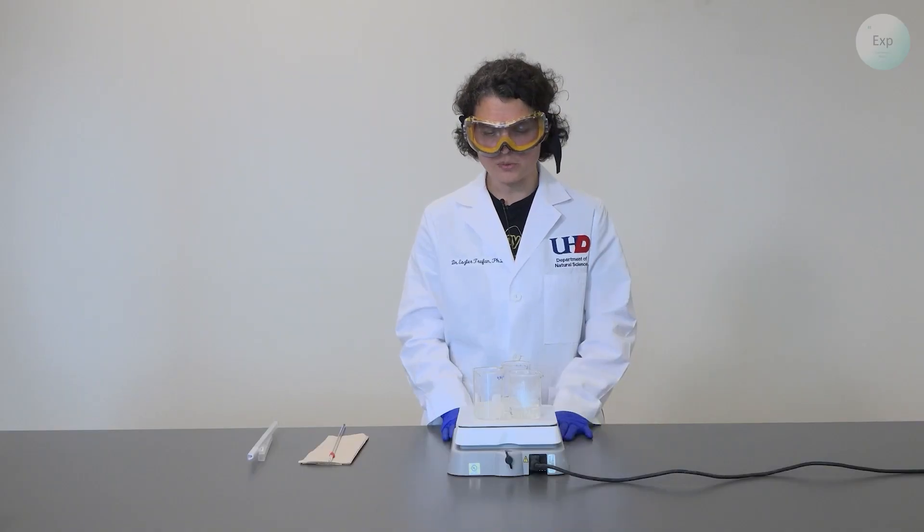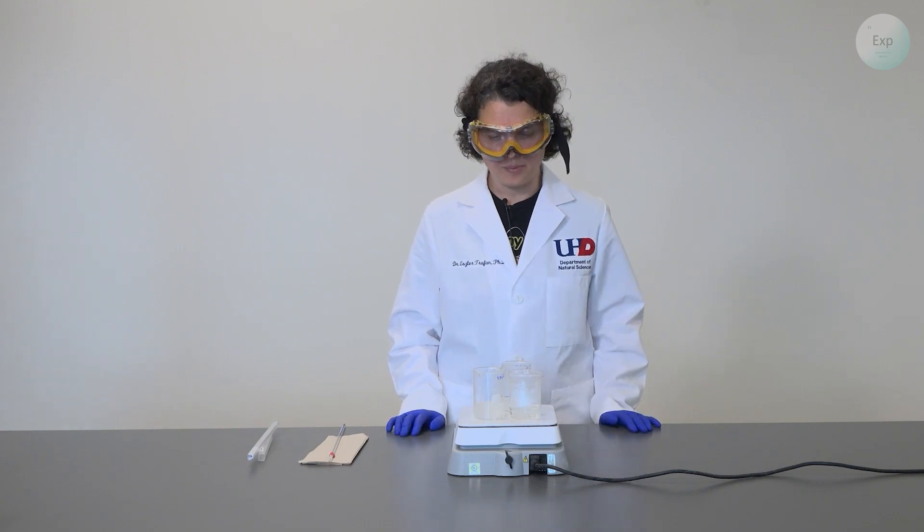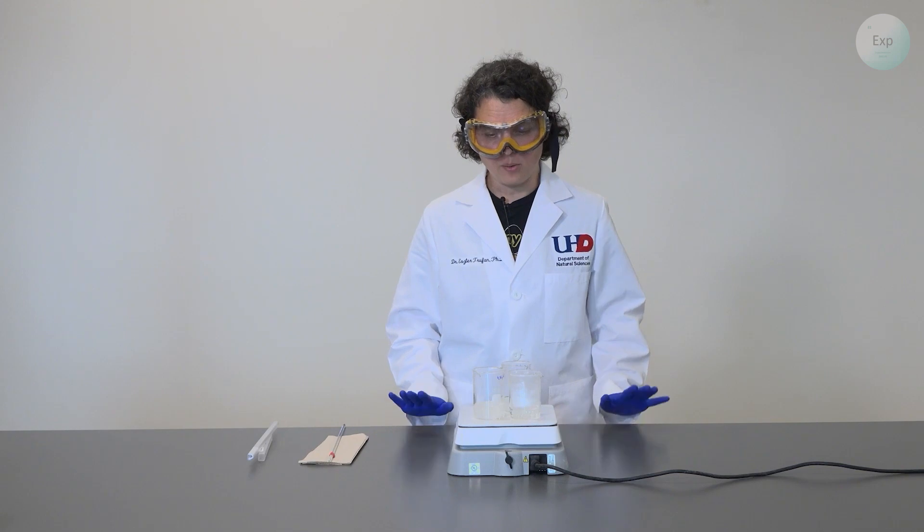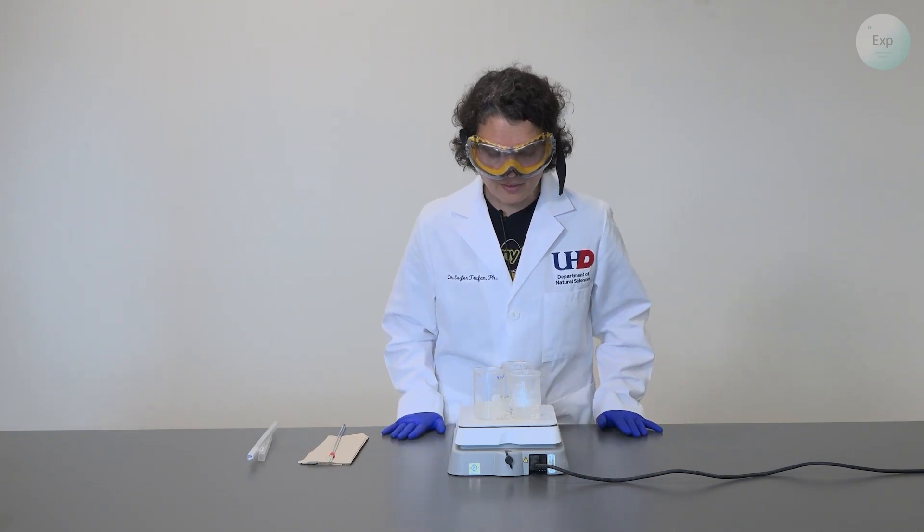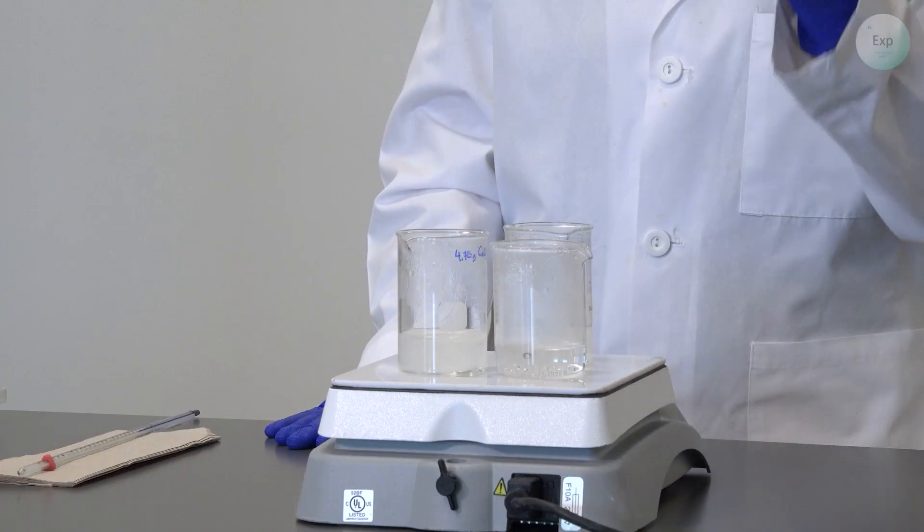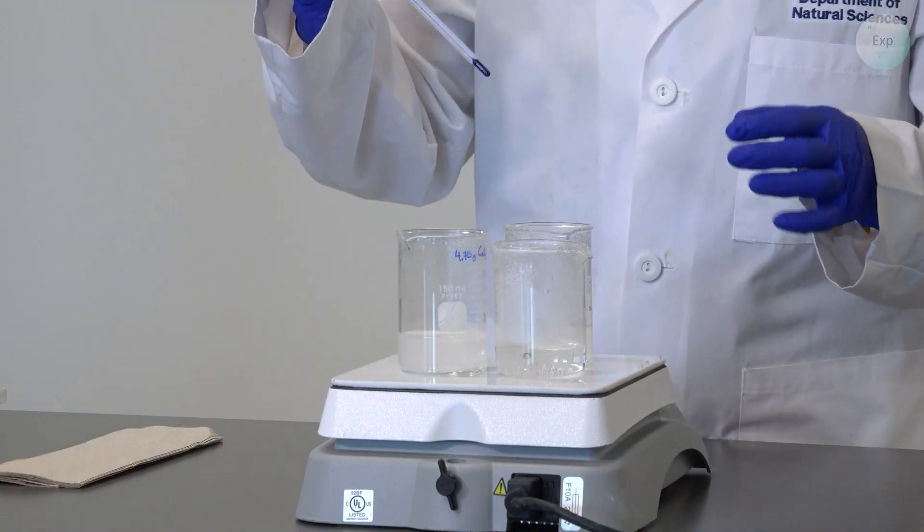It has been some time since our solutions have been on top of the hot plate and our water has been on top of the hot plate and it appears that they are now boiling and we can tell that they are boiling because small pockets of vapor are forming at the bottom and they are climbing to the top. So this is a good time to start recording the temperature.